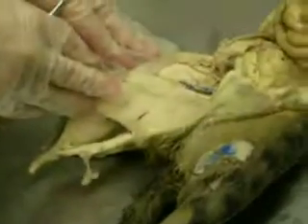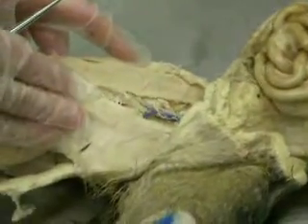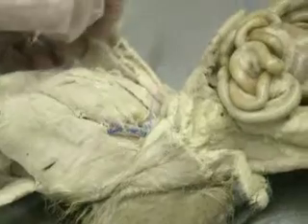Of the thigh. So you have two muscles. You have the gracilis — this is the gracilis here on the inner thigh. And then this muscle here, this is the sartorius, more lateral. So the gracilis is more towards the inner part, the more medial. The sartorius is more lateral.